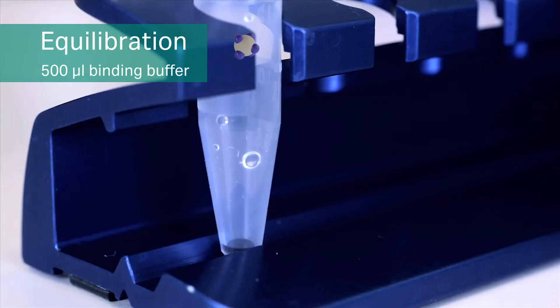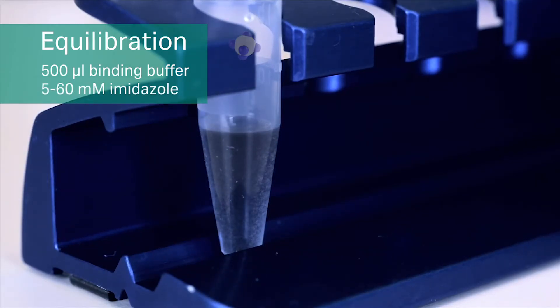Add 500 microliters of binding buffer with 5 to 60 millimolar imidazole.